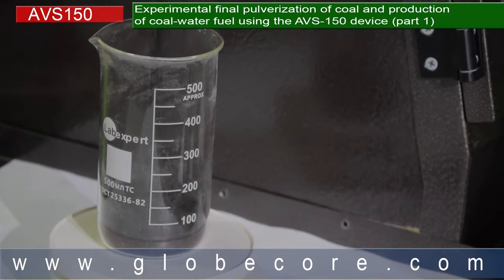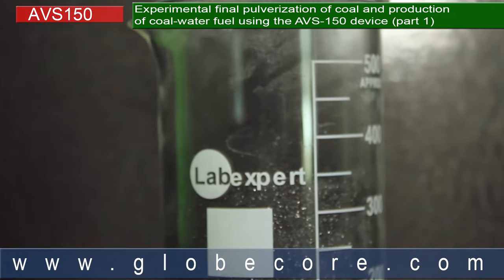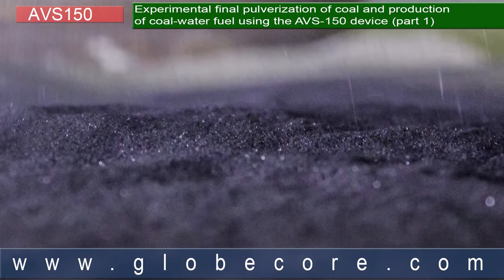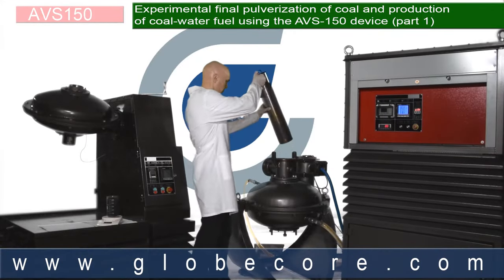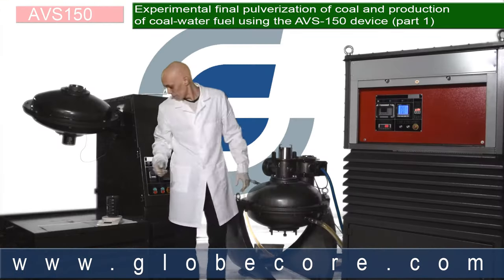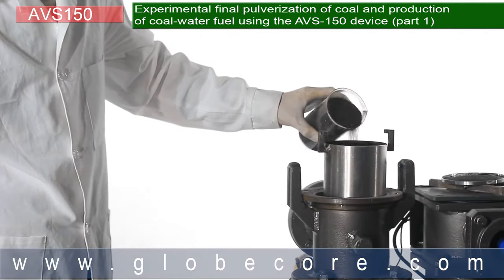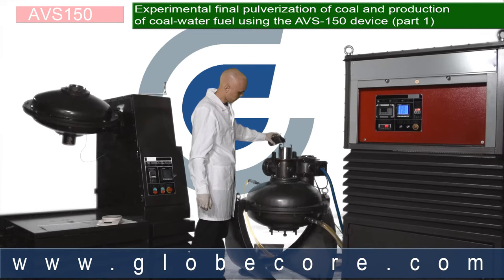The objective of our experiment was to pulverize coal with particle size 10 to 15 mm to dust with particle size 0 to 300 micron, and mix that with water and plasticizer to make coal water fuel, CWF. The experiment was performed using the AVS150 vortex layer device. The main principle of making coal water fuel is consistent pulverization of coal with specified parameters and precise dosing of additives to improve rheological properties and combustion stability.